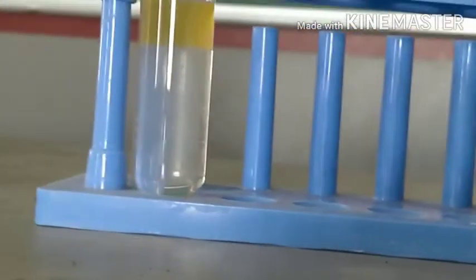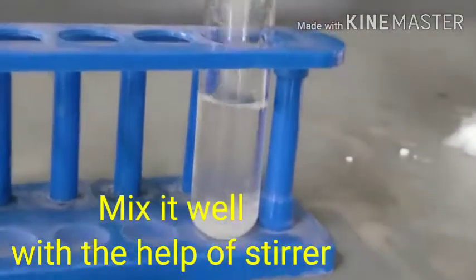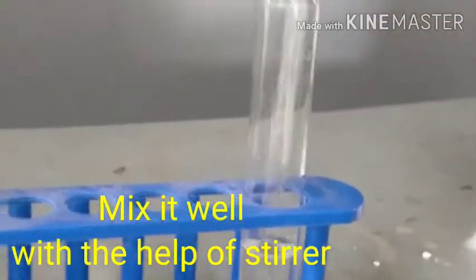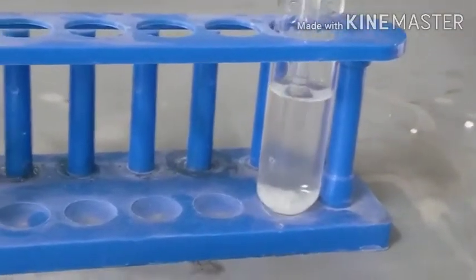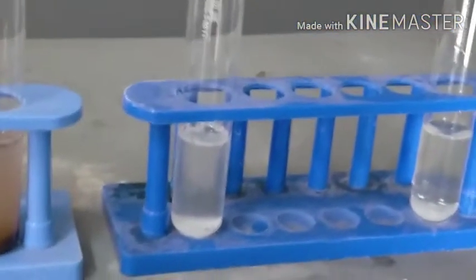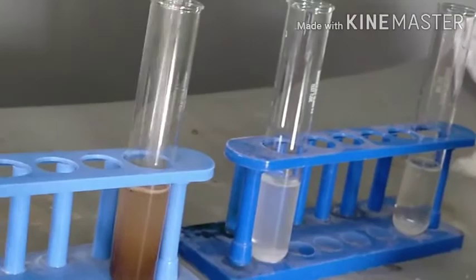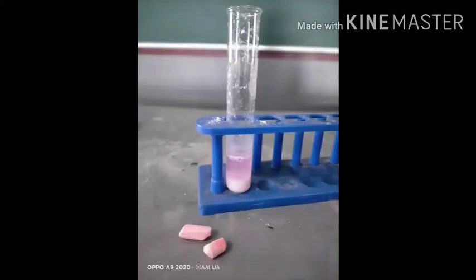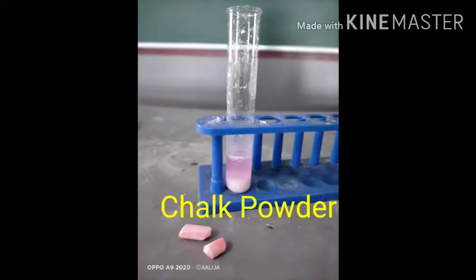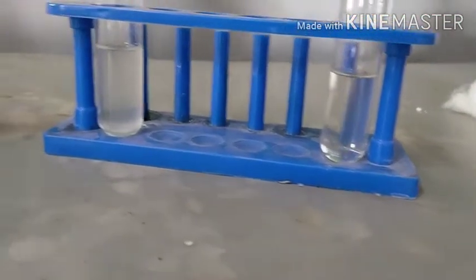Now observe it very carefully. The next step is we need to mix it well with the help of a stirrer as shown here.